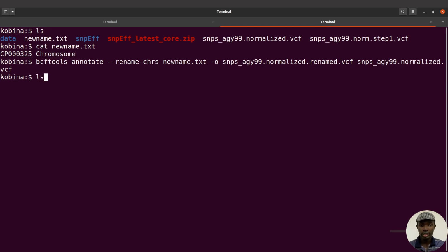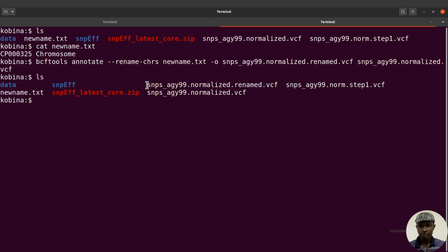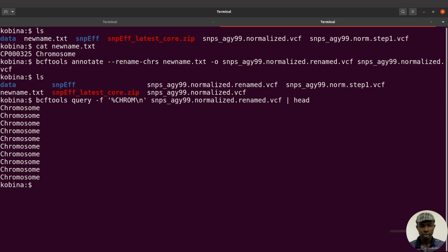Now before we confirm, let's do an ls to see the output file. That is this one here. And so what we are going to do is to now run bcftools query to take a look at this file and then display the chromosome names. So I'll say bcftools query -f, I'll bring my quotes, I'll say %CHROM\n, and then I'll specify the file, which is snips normalize.renamed. I'll just say head. Now execute the command. Now you can see that the chromosomes have been renamed to this one here.